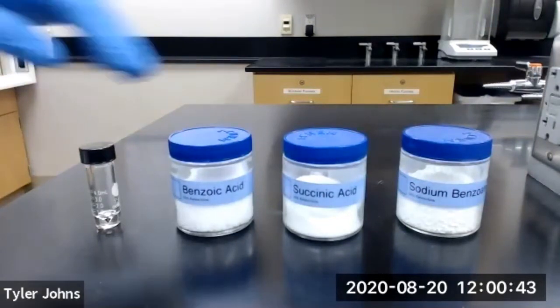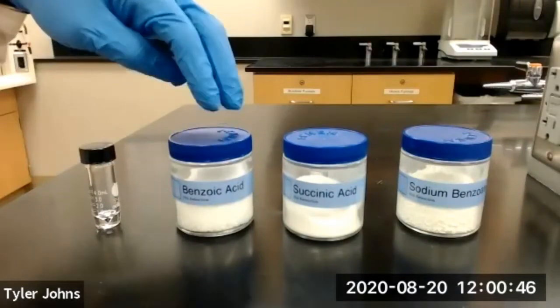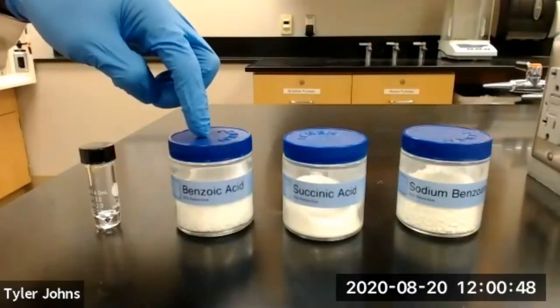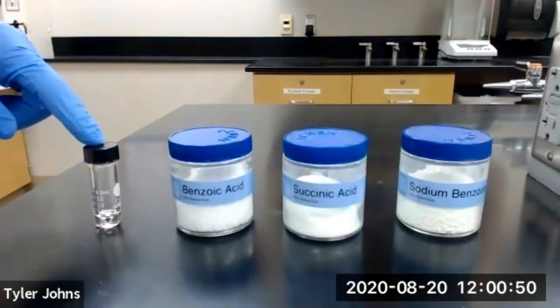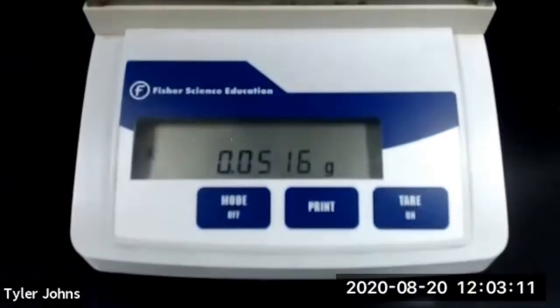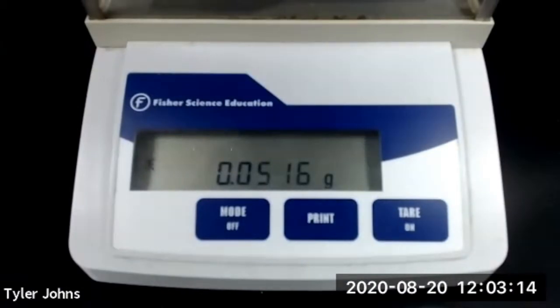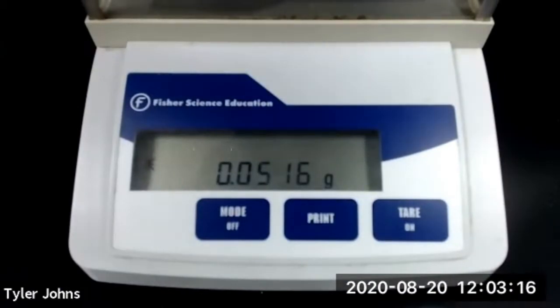We're going to start with benzoic acid. We need to transfer 50 milligrams of benzoic acid into a five milliliter conical vial. The mass of benzoic acid is 0.0516 grams.